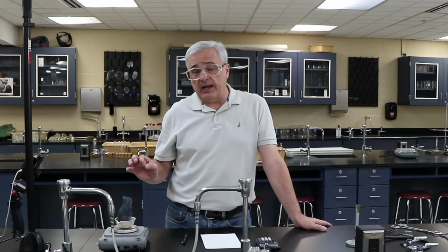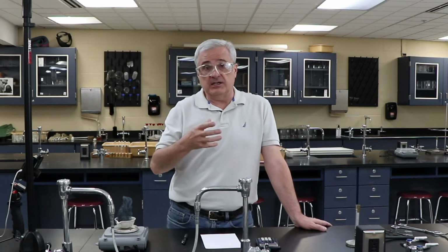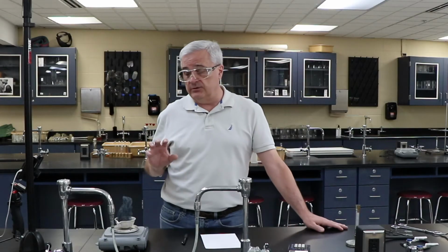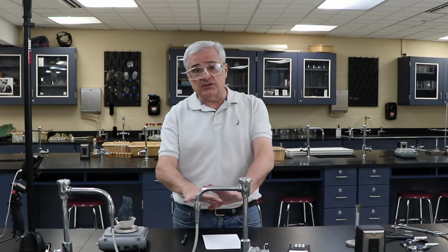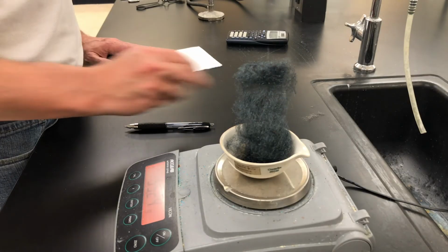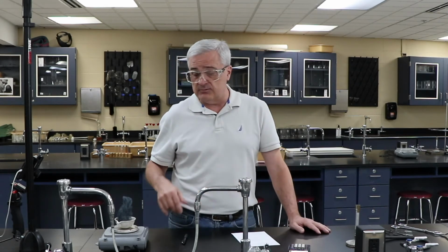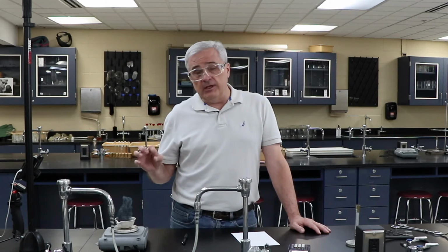All right, let's talk a little bit about what happened here. We have our balanced chemical reaction. We have the oxygen, we have the iron, they combined. There are a lot of errors in this that are going to prevent us from doing a whole lot more than just observing that mass was increased. We lost a lot of the reaction. There are pieces of the original 3.42 grams that came off as I was trying to get it fluffed out, so that was partially lost.